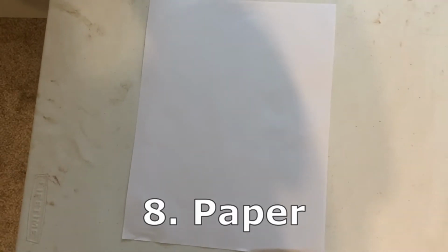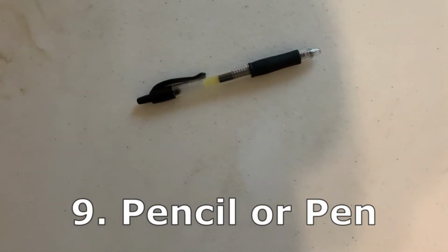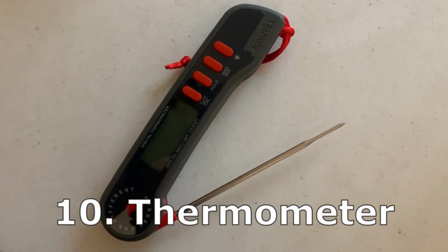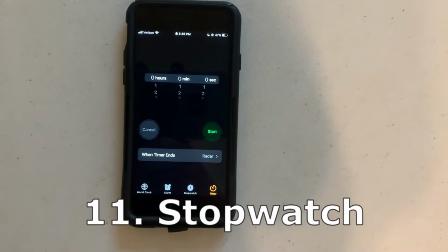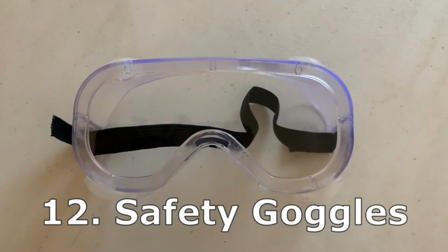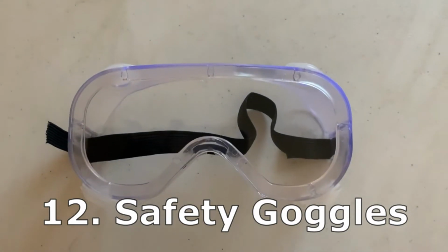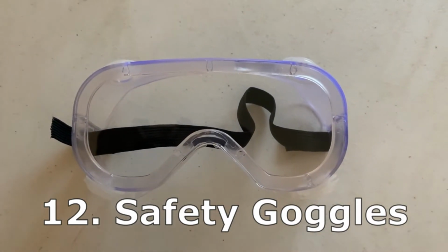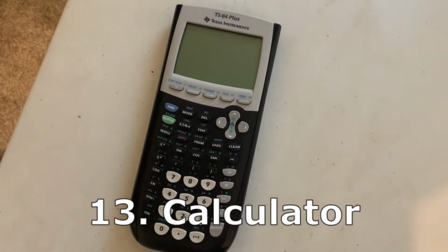8, 1 piece of paper. 9, a pencil or pen. 10, a thermometer. 11, a stopwatch. I'm using this iPhone right here. 12, safety goggles. While nothing that we're working with is dangerous, it's just good practice to keep our eyes covered in the event of splashes. And 13, a calculator.